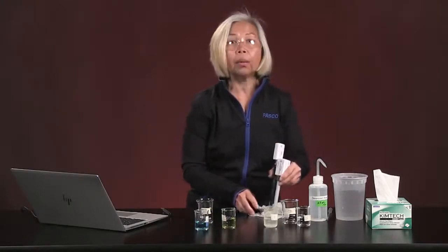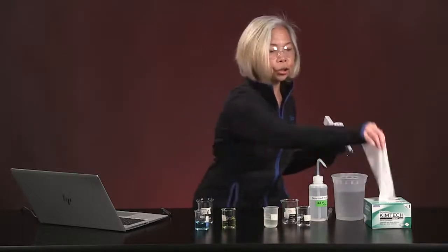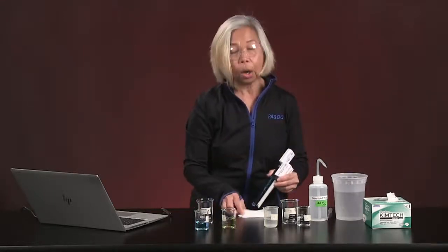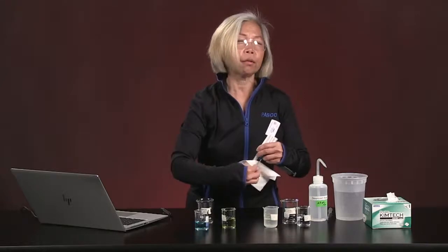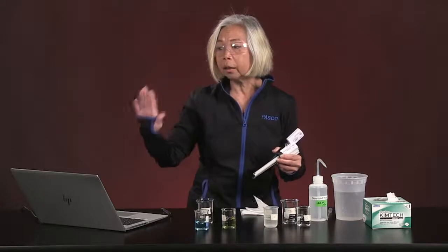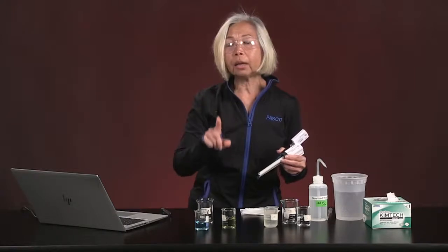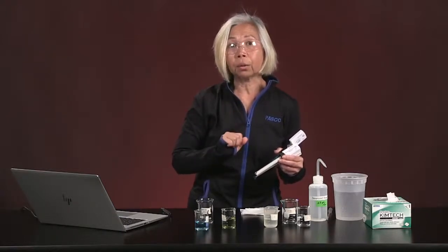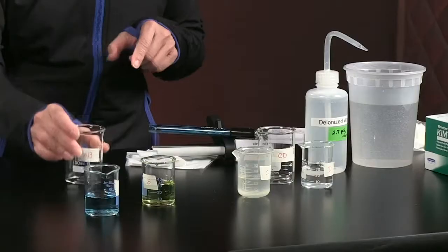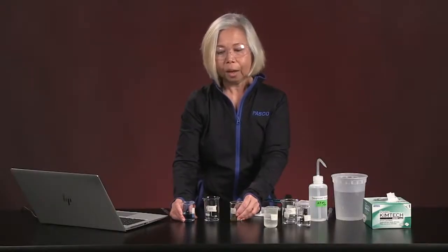All right. So now we have measurements of temperature, conductivity, and pH of each of our solutions. Let's see what happens when we mix them. Are we going to have a physical change? Are we going to have a chemical change? So I want you to make sure that not only are you watching our Sparkvue screen, that you're also looking at the data you have already collected on each of our solutions. So let's get started. I have a beaker in which I will mix solution A and solution B.